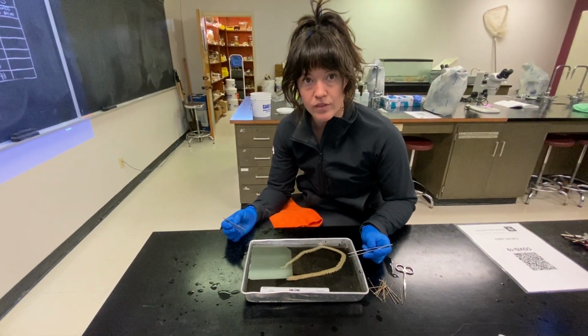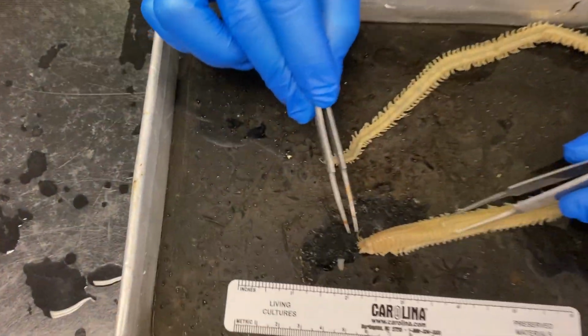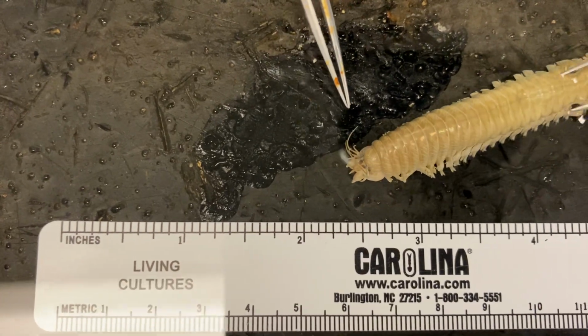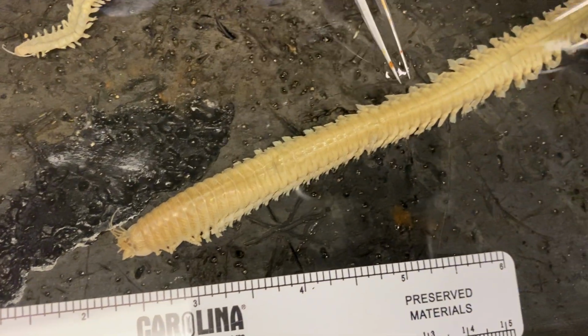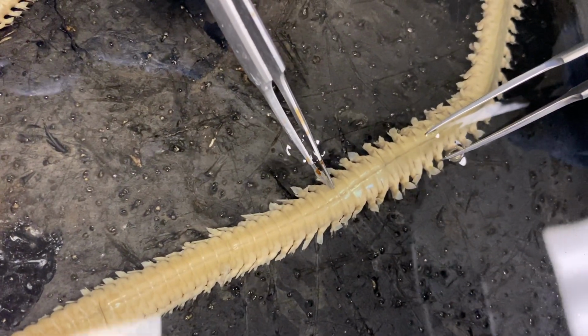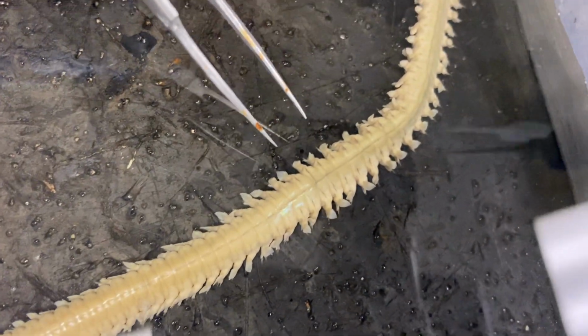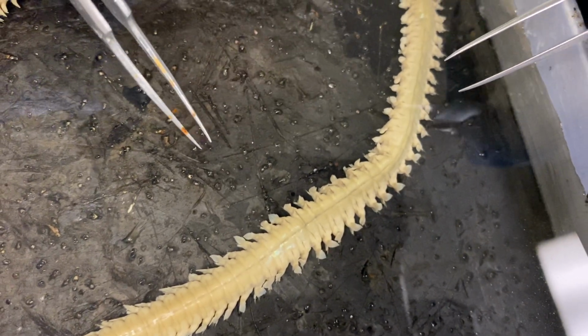We're going to start with external morphology. At the anterior portion, we have the prostomium with associated appendages. Then following along the body, we have segments. These segments are split up by annuli at the segmental boundary. Annuli comes from the word annulus, meaning rings, also how the phylum gets its name, Annelida.